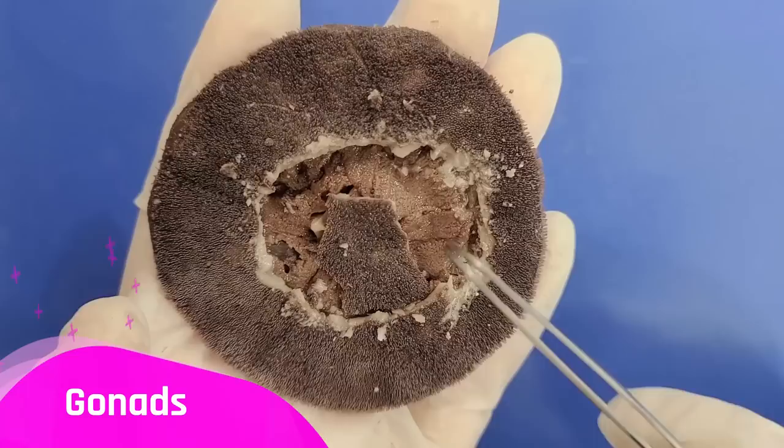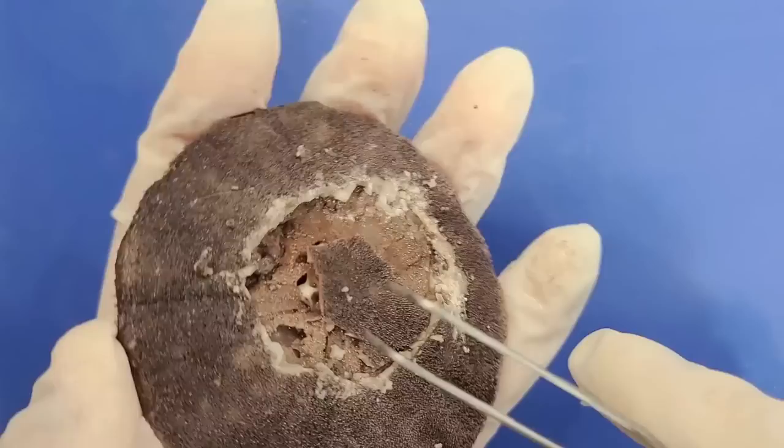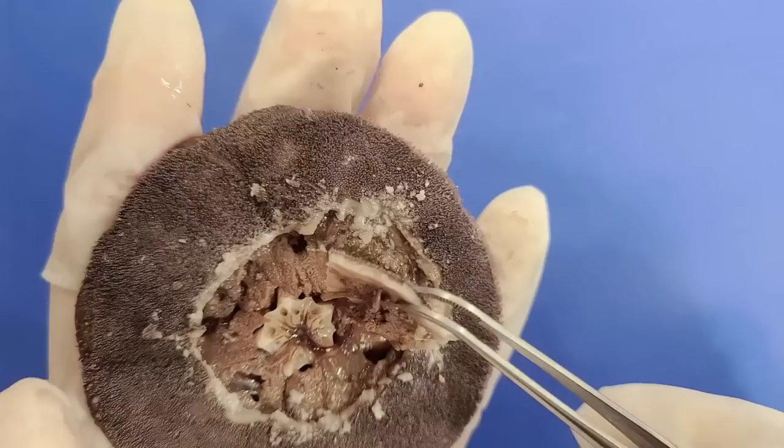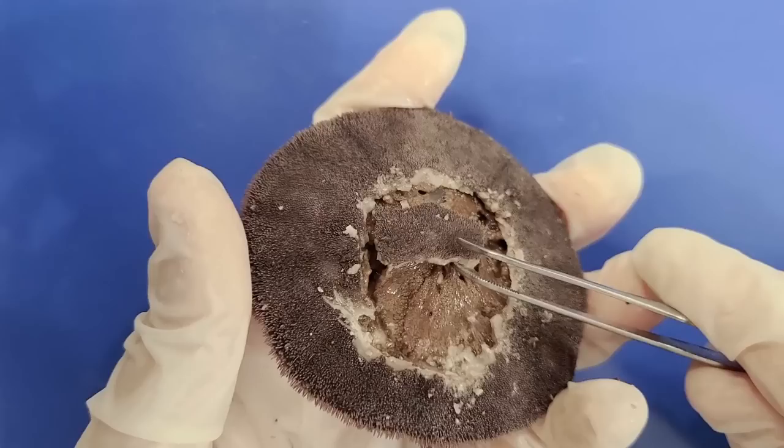The most conspicuous thing you see here are the four gonads that lead into the gonopores we saw before. Unlike sea urchins which have five gonads, sand dollars only have four. If I lift this piece of test, we might be able to see the gonads leading into the gonopores — it's the string we see there. On the other side as well, we can see how the gonads lead into the gonopores.